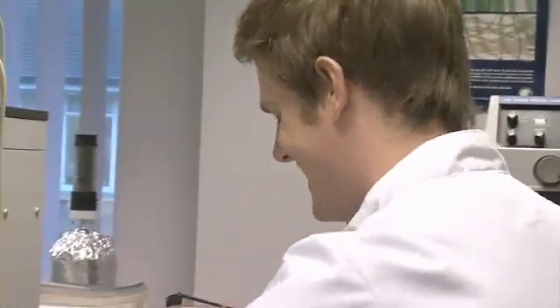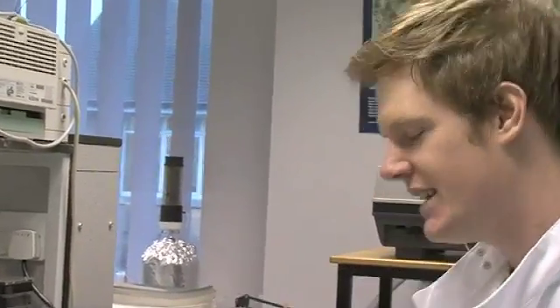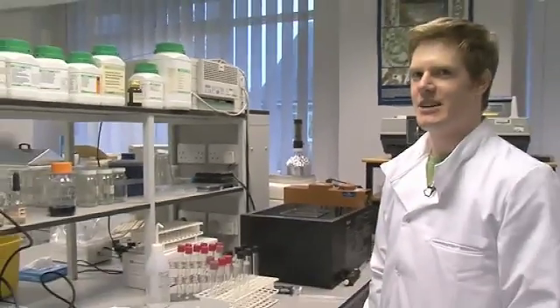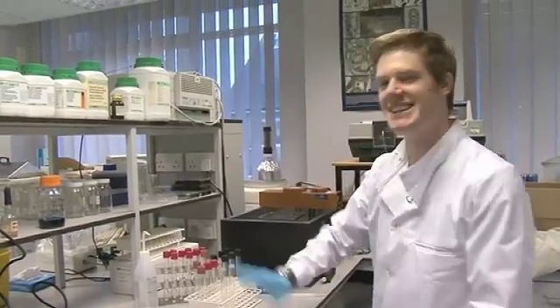What's critical is that I need to add reagents at exactly the right time — you have to put it in at exactly the right second, so I'm sitting here with a stopwatch. The first time I did this, I was deionizing some water and completely forgot about it, so it overflowed — and every minute I had to run over, wipe it up, come back and do the test, then run back over. Absolute nightmare. The second time, I knocked over a bottle of dye, so I had to do the same thing.